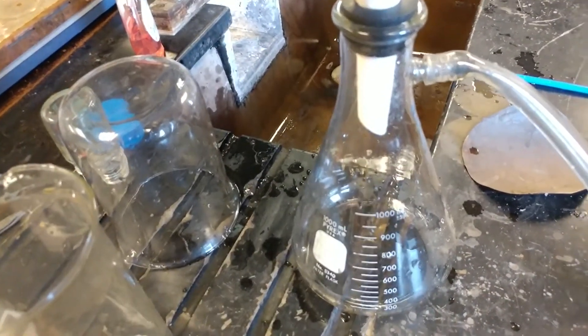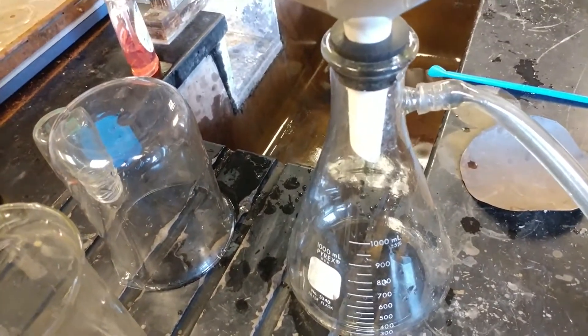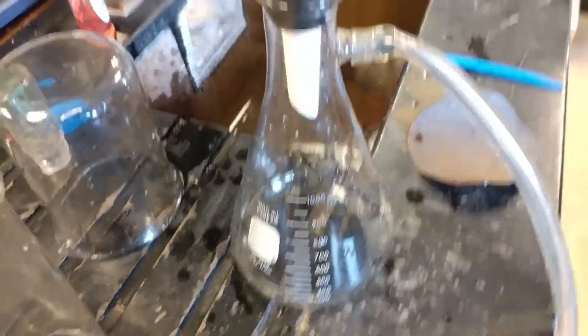Ever so slowly. When it gets up there I'll test that, see if it tastes good. This is gonna take a minute. So in the meantime, I'm gonna pause it again when it gets a little bit more.